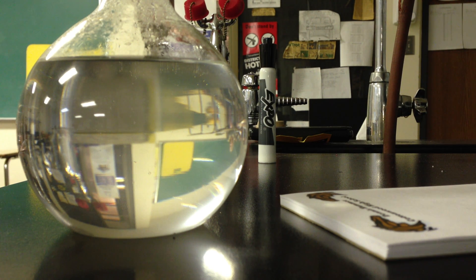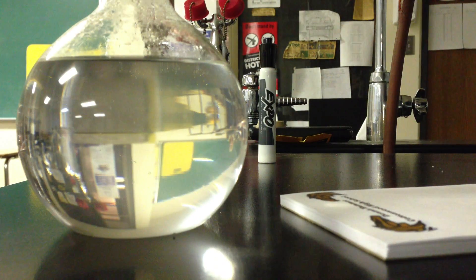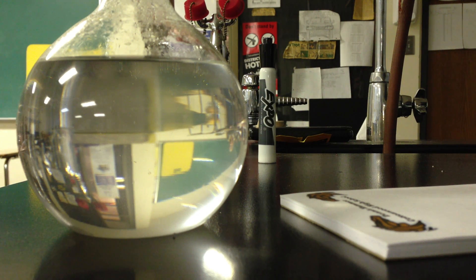So even though I stirred it up, it still wouldn't dissolve. So what I did is I heated it up and usually for solids, if you increase the temperature, their solubility increases. That's true for almost all solids. And then I cooled it back down to pretty close to room temperature right now. And now all of it is dissolved.